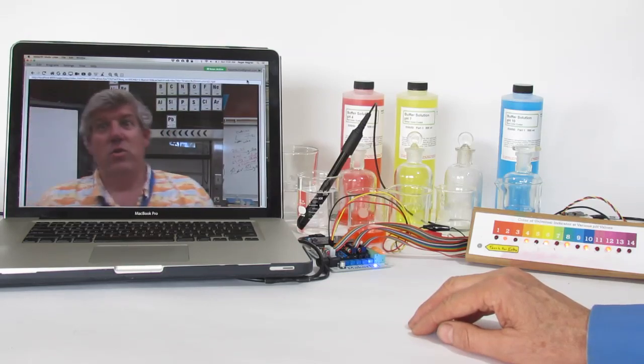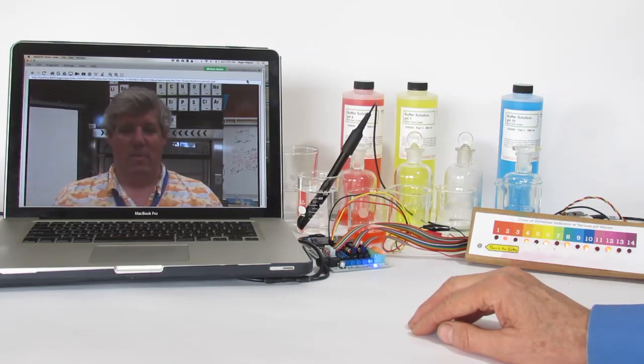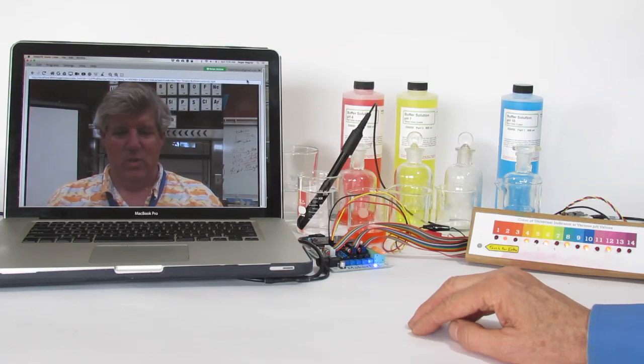Our goal today is to see if we can determine the equivalency point, that point in which the acid has been neutralized by sodium hydroxide. This neutralization is the point at which they have normalized or reached a pH of 7.